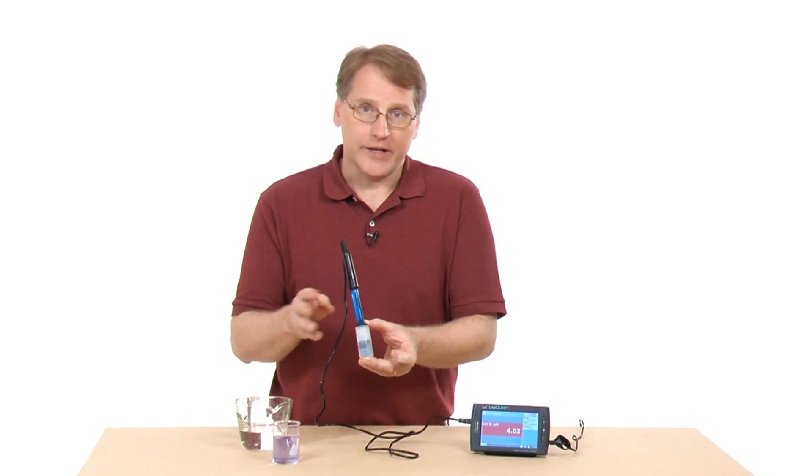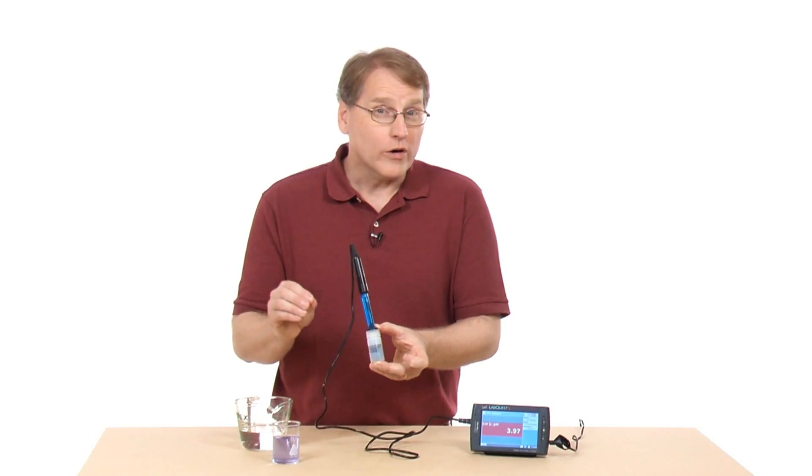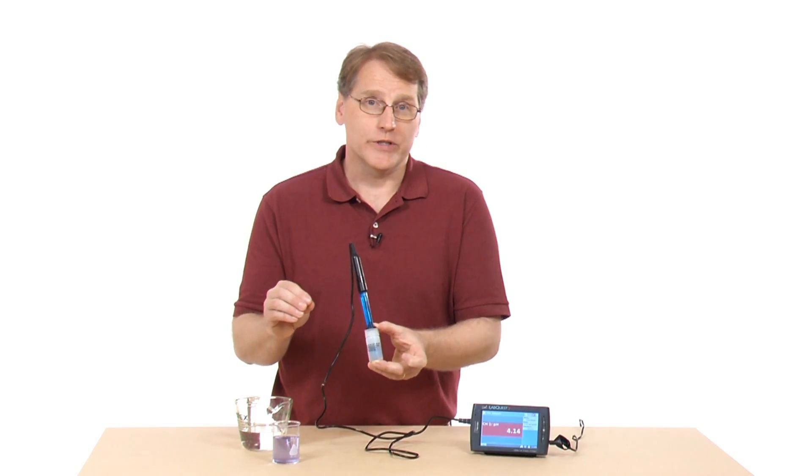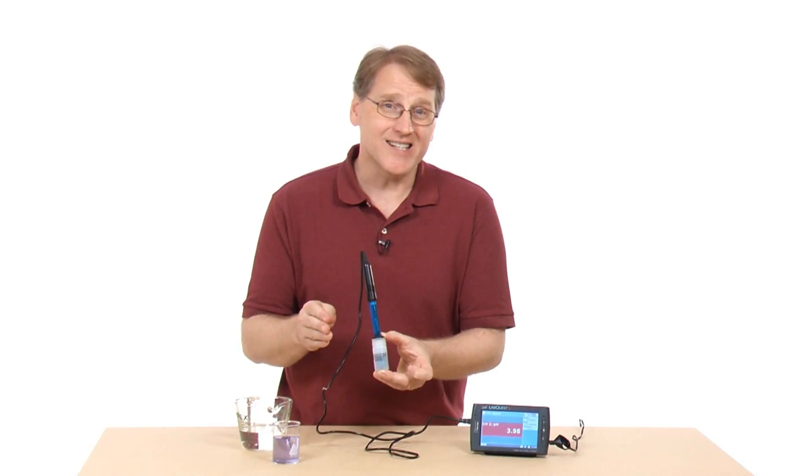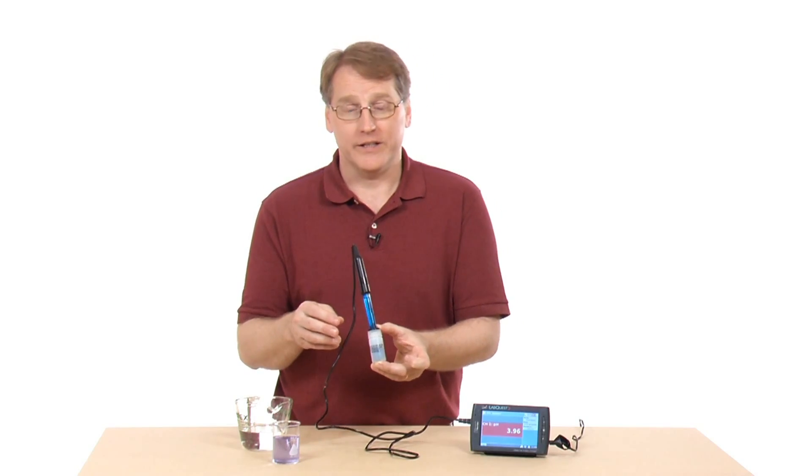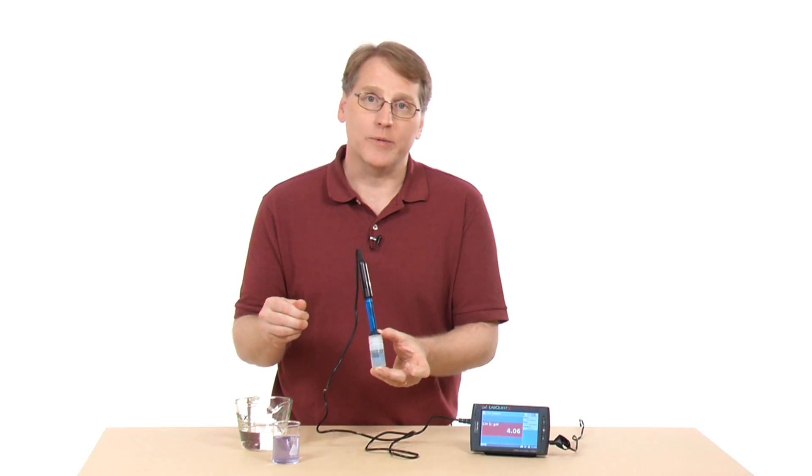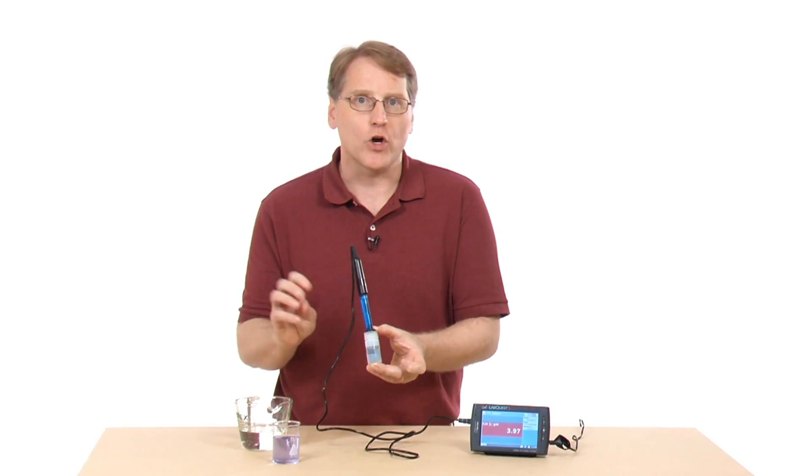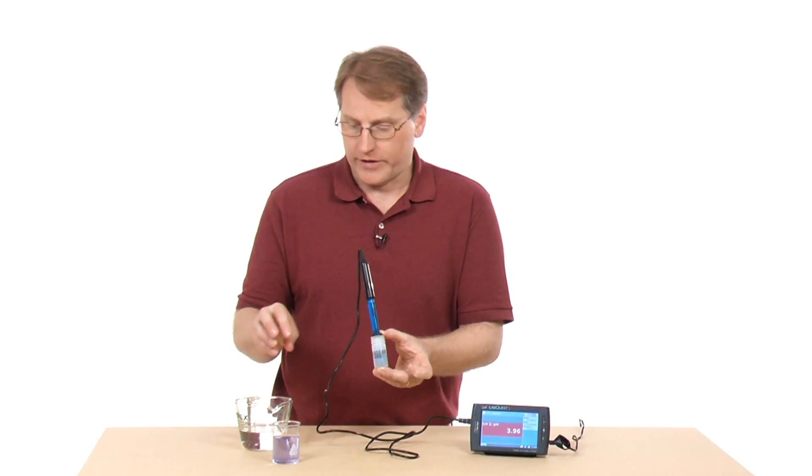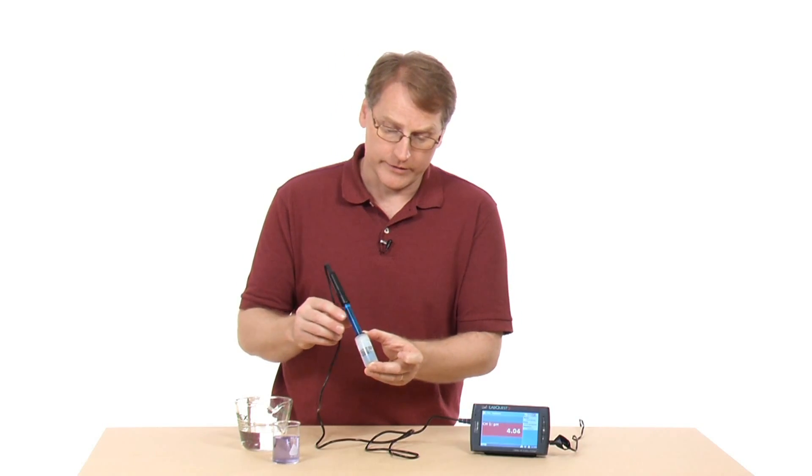Without the ions, it doesn't work. Or sometimes they put it into a solution and find that it's actually slightly acidic, because the distilled water has been sitting around for a while and you have some carbon dioxide dissolved in it, so you have a weak carbonic acid.